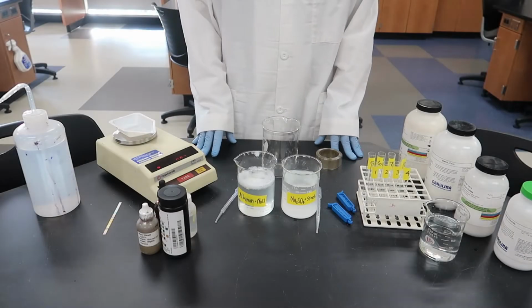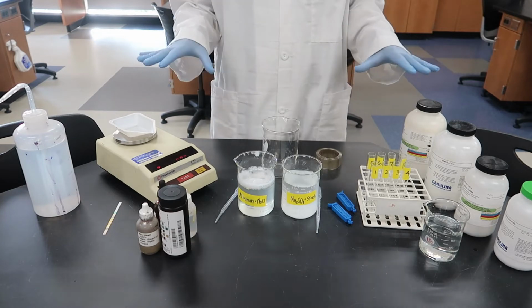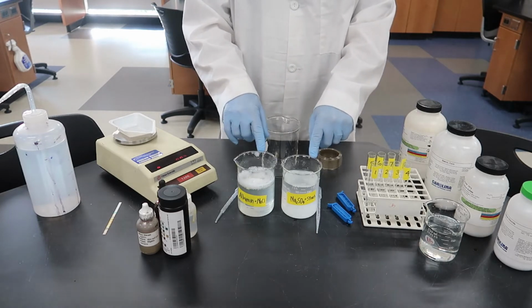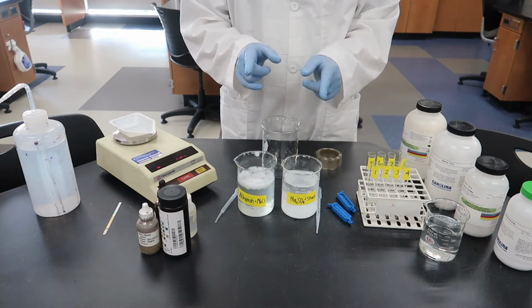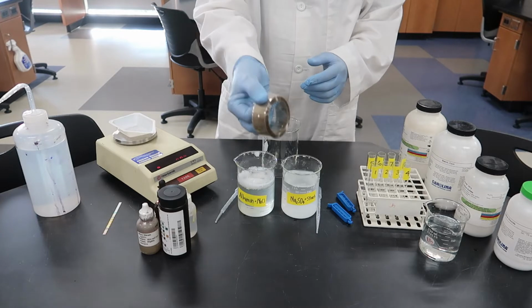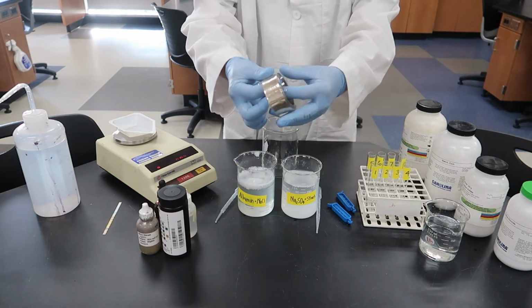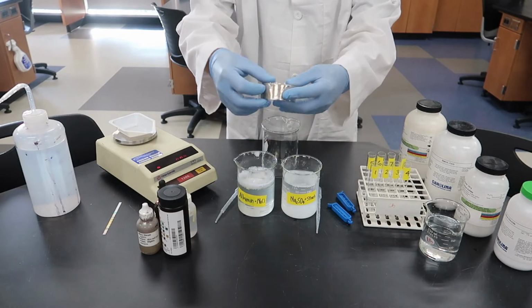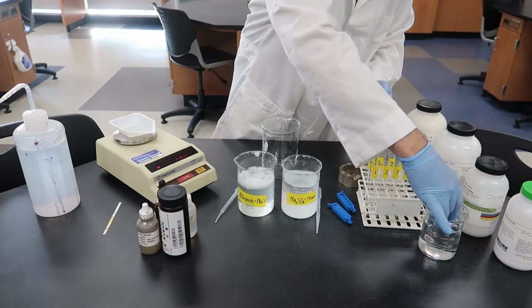Okay, as we get started, there's a lot here. We've got lots of different things to look at. Notice that I've already made my beakers of 2 different solutions, and I've mixed 2 of the chemicals together so that we can combine this and not do each one individually. I have my dialysis tubing. It looks like tape. It's not sticky though, and it's actually a tube once you soak it. I've got a couple of pieces already cut in this beaker.